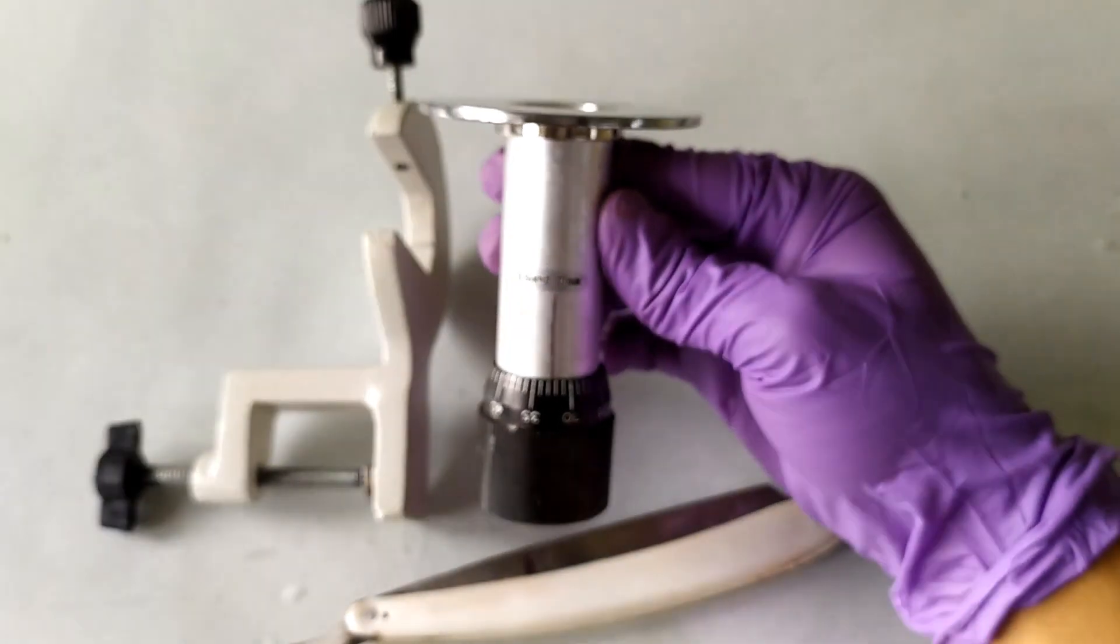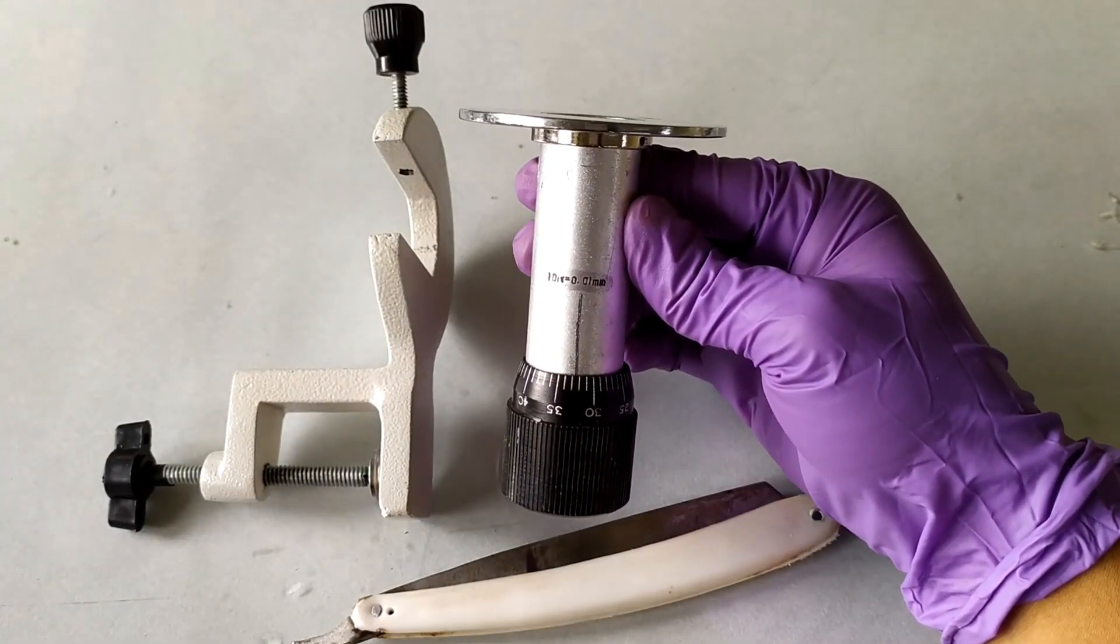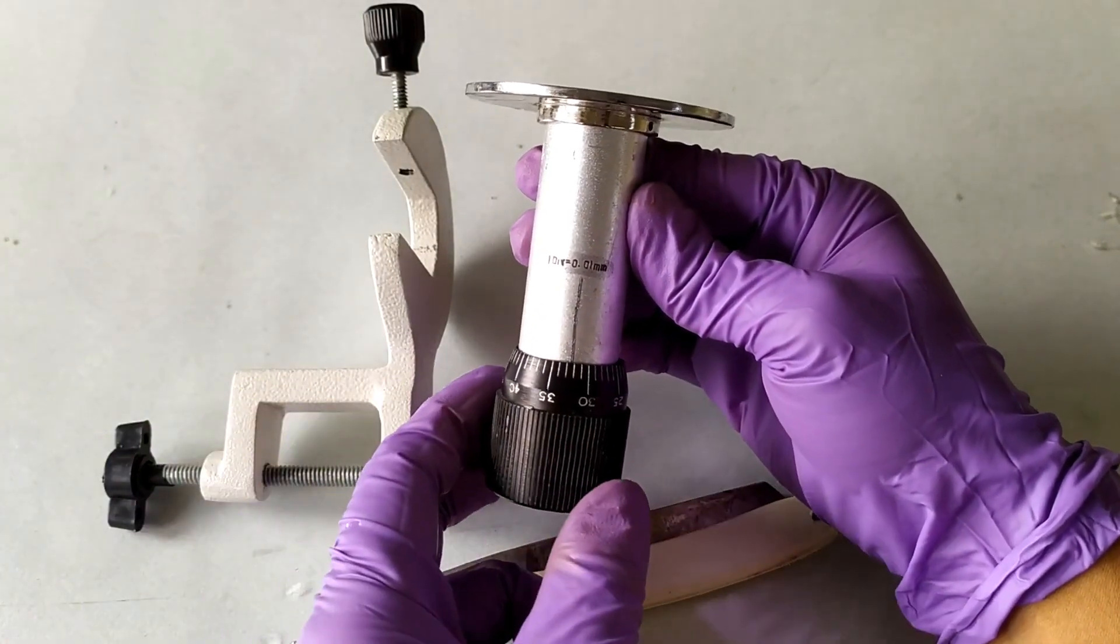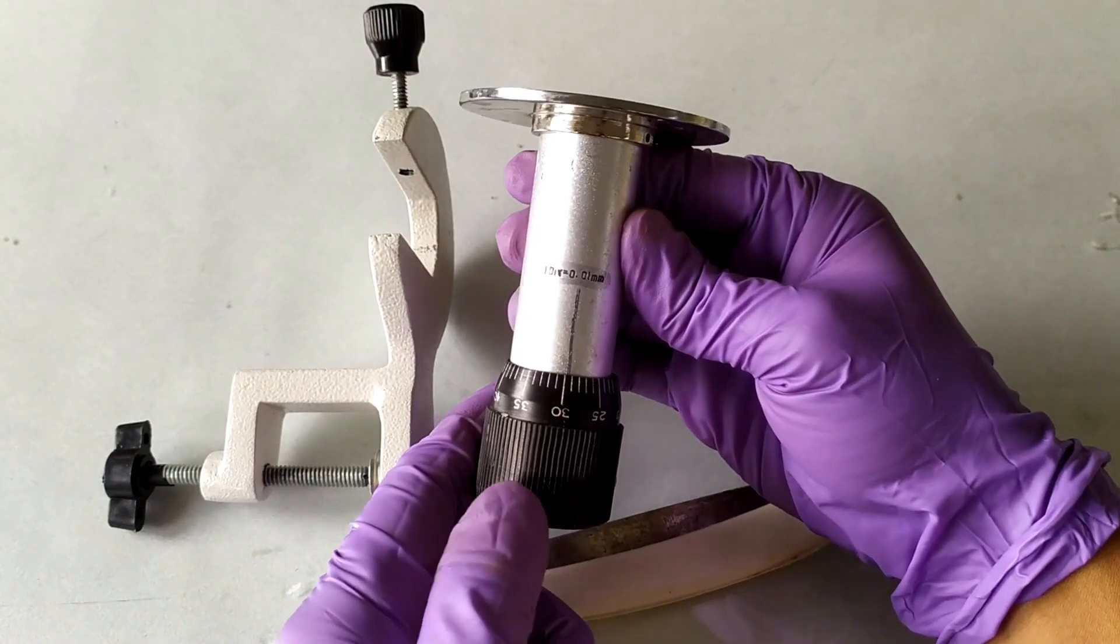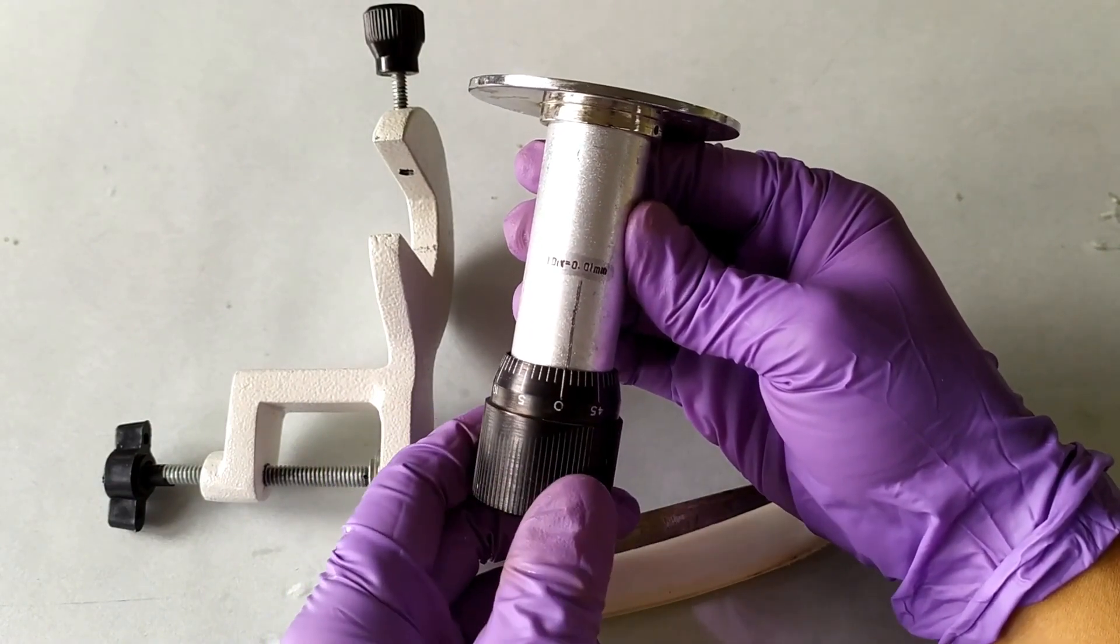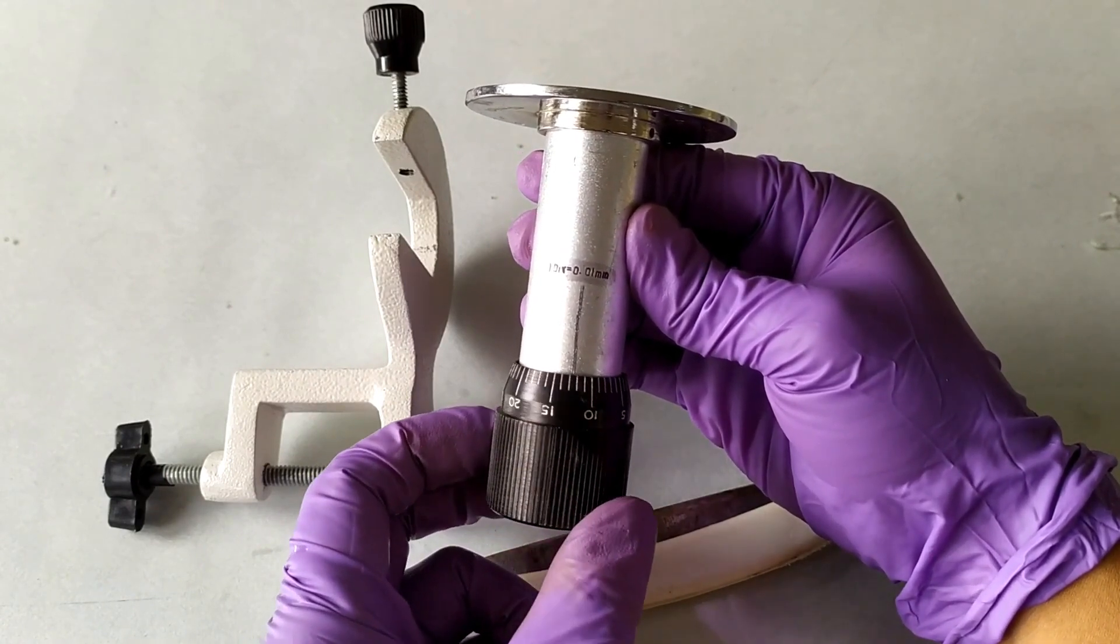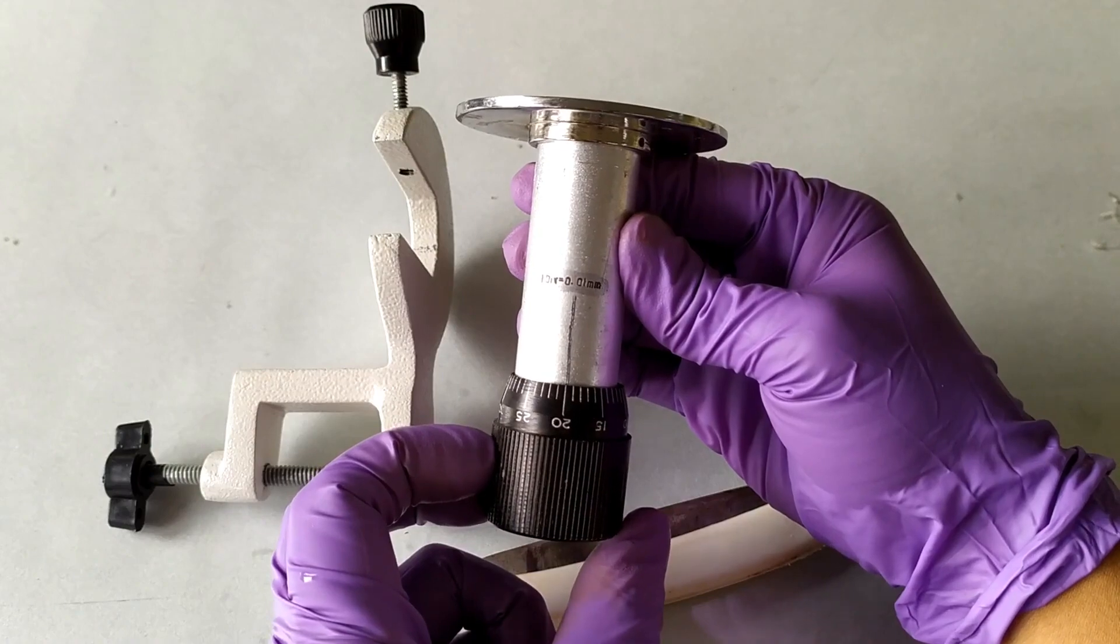However, practically speaking, it's quite difficult to obtain a whole section which is that thin. The thickness graduation is also not that accurate and reliable when you actually use the hand microtome. I therefore usually jump 10 to 20 divisions while section cutting to get at least a couple of thin and complete sections out of every 20 to 30 slices.